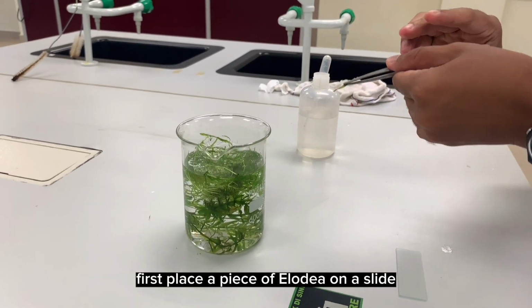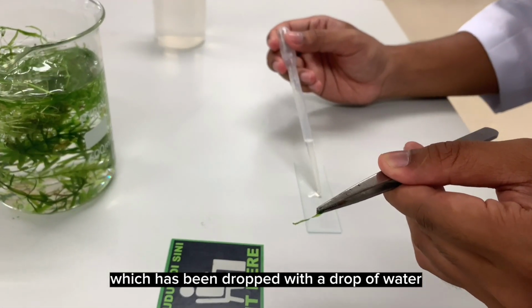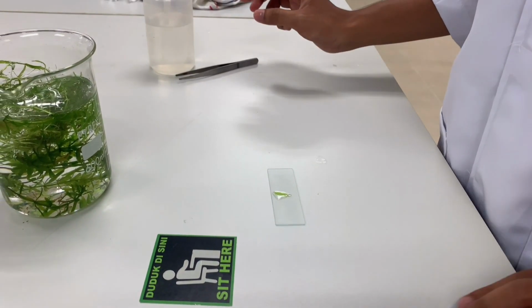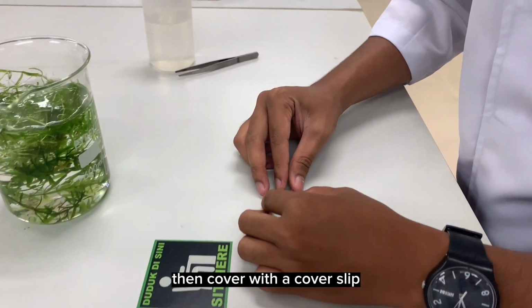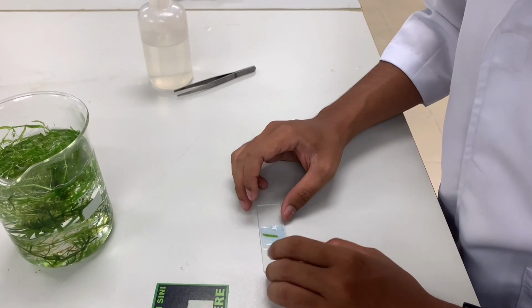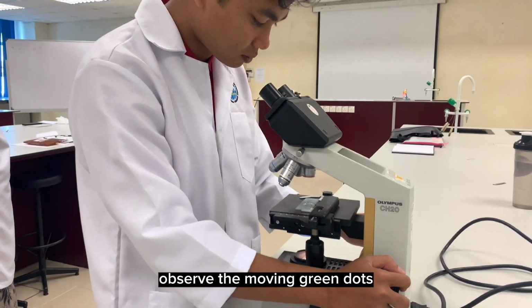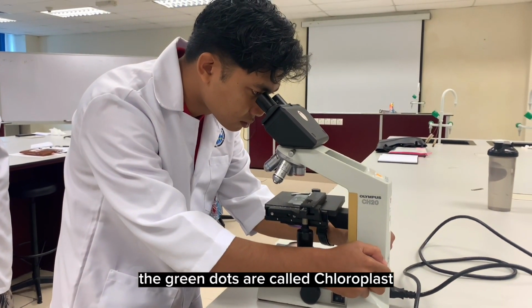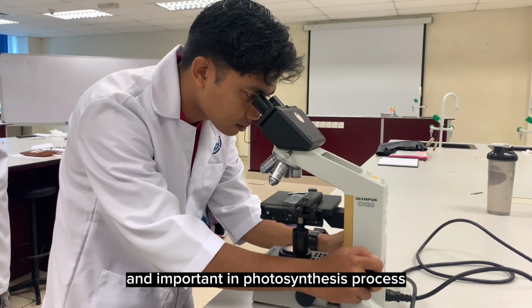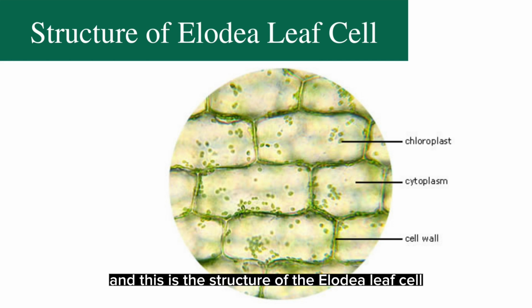First, place a piece of elodea on a slide, which has been dropped with a drop of water. Then, cover with a cover slip. Observe the cell under low and moderate power. Observe the moving green dots. The green dots are called chloroplasts and are important in the photosynthesis process. And this is the structure of the elodea leaf cell.